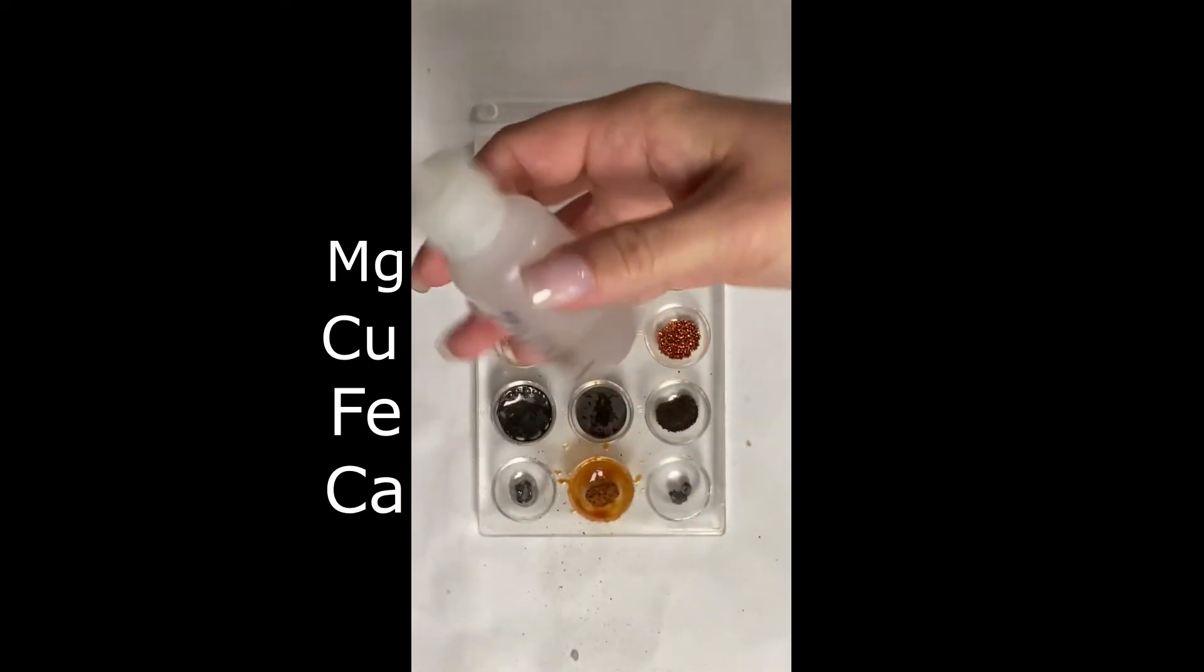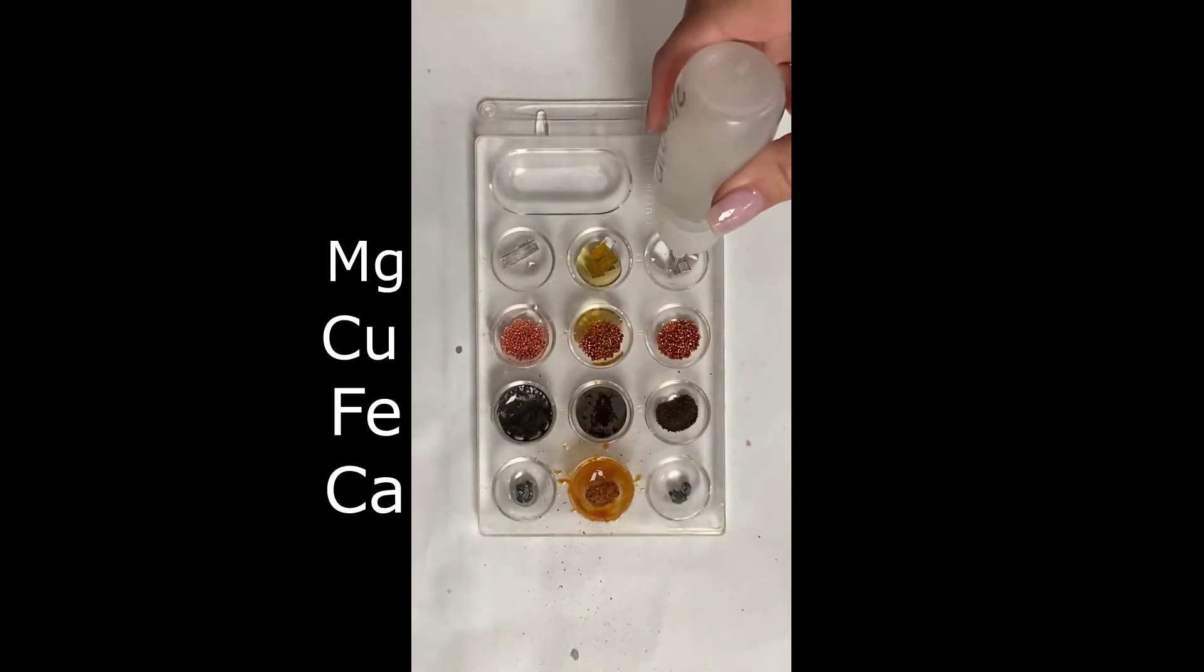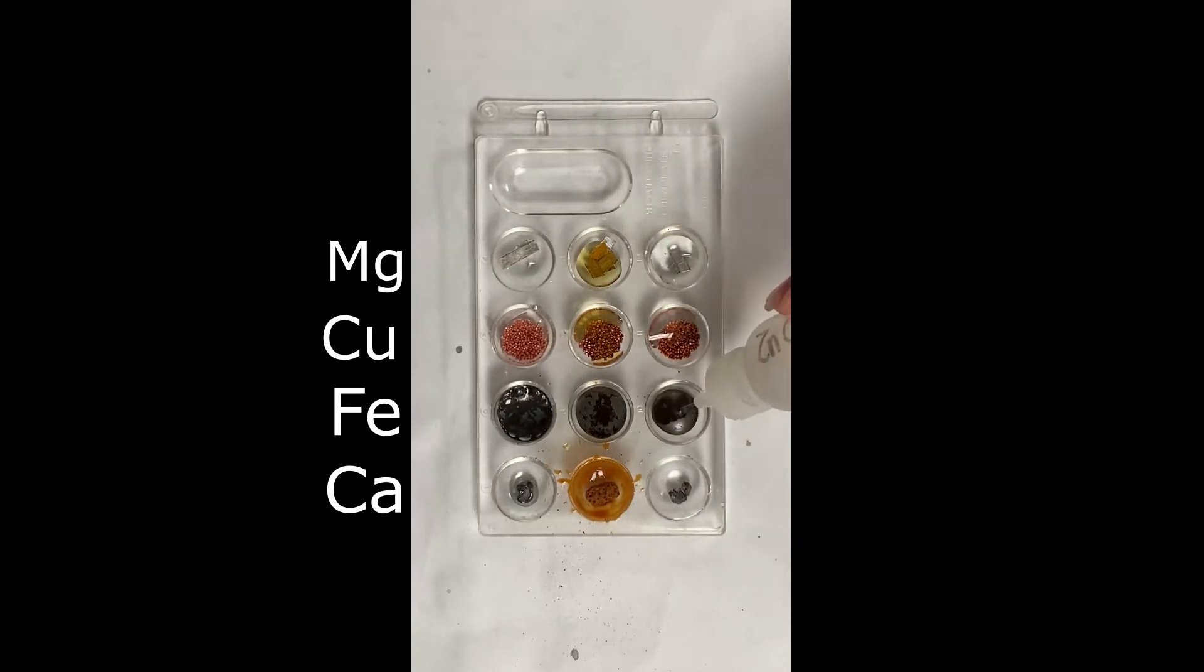All right, and our last one is going to be our zinc nitrate. I'm going to go ahead and put a little bit in each well. Again, go ahead and write down your observations, but remember to look back at the past wells, because I can say that there are some that will start to react at a later time than initially.